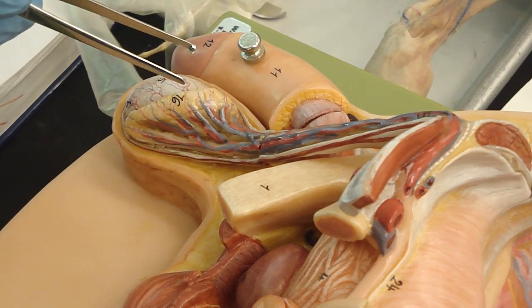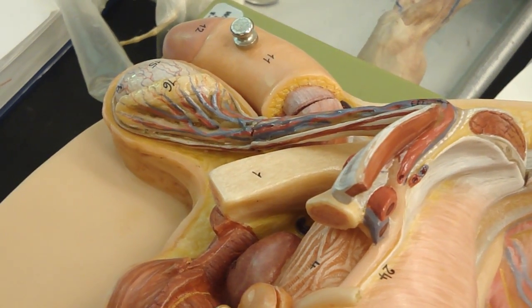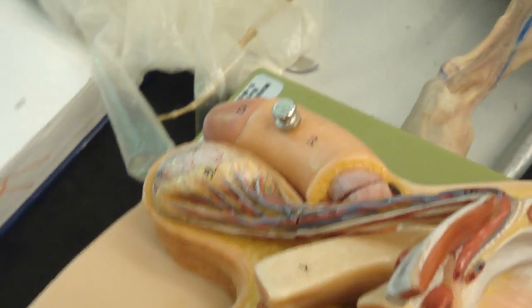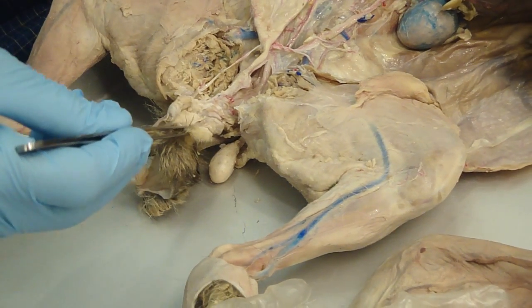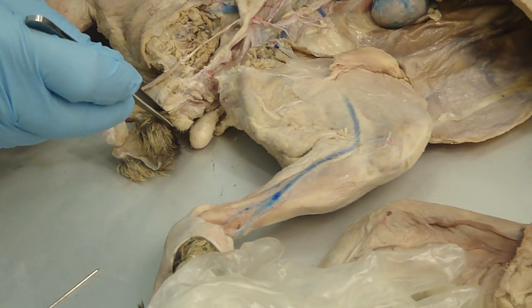So, did you see the anal glands on this cat, the male? You may want to come up here and look afterwards. We exposed them on this side here. There's the anus. There's an anal gland on the male. See that bump? That's the anal gland. Now I did it on the female, and the female's was very, very tiny.